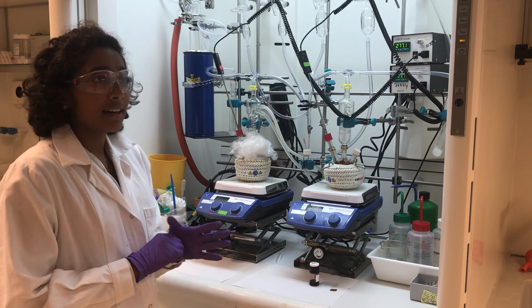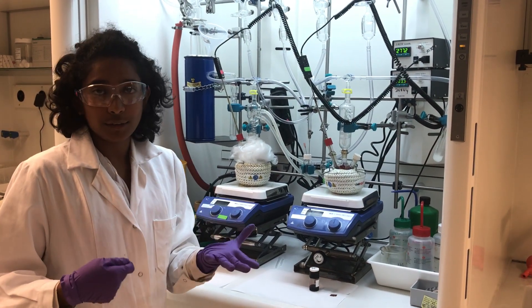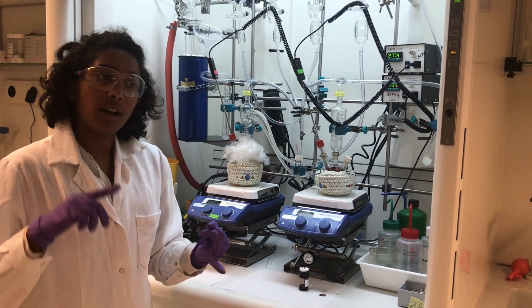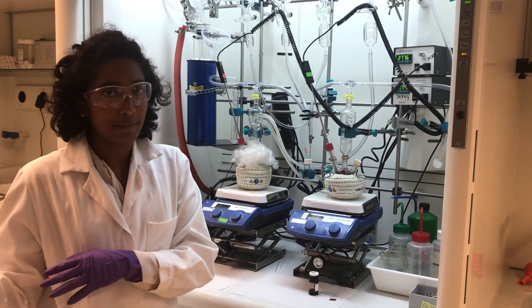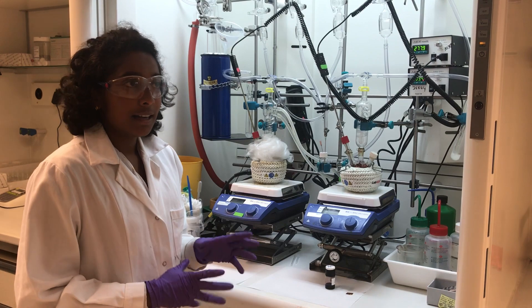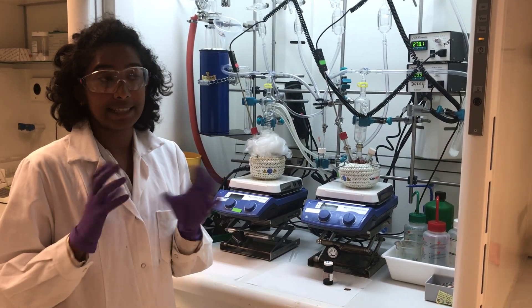Usually, depending on the different oil used for cooking, the fragrance or taste of the dish also changes — whether we use coconut oil, olive oil, or sunflower oil, the dish we make is different. Similarly, the solvents we use here define the structure of the nanocrystal.